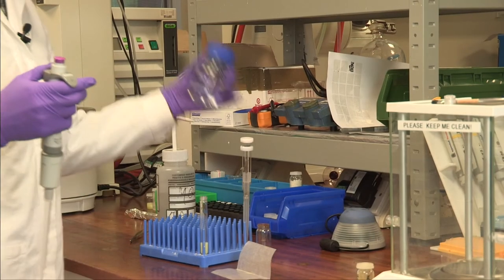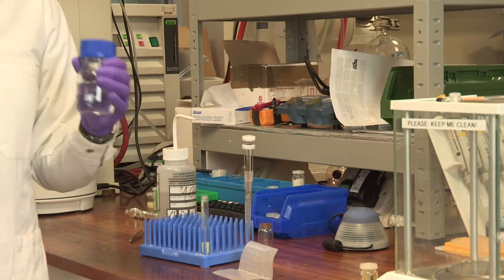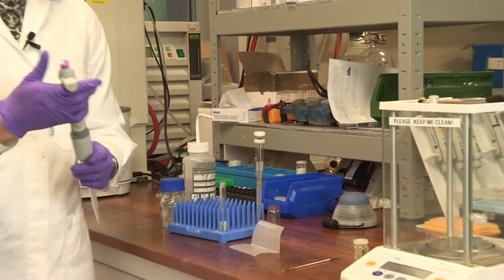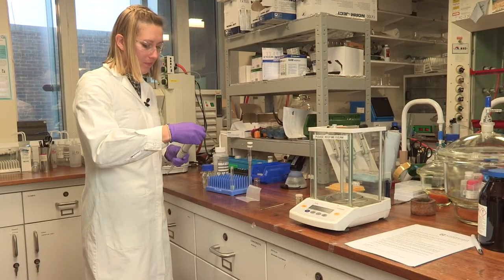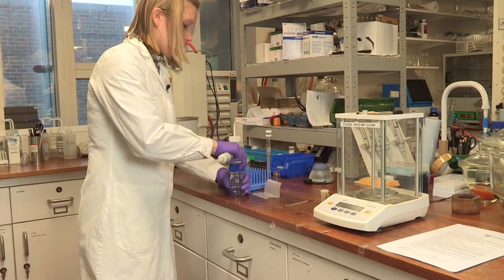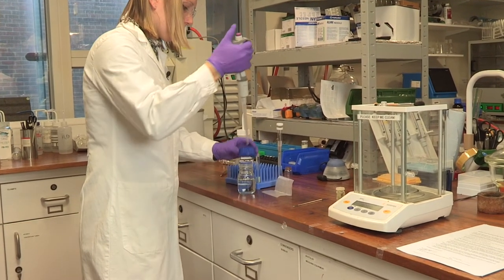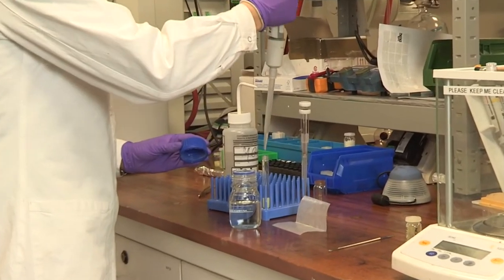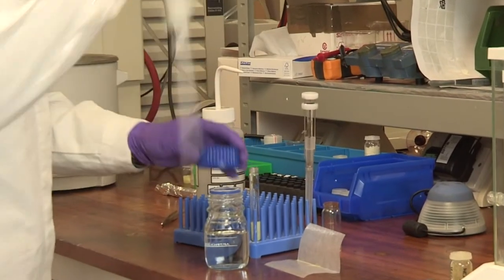The final component I'm adding is actually a basic solution — sodium hydroxide. The only reason we need that is to help break down the plastic in the first place. If we just stick plastic in water, it's going to take about 500 years to break down. This kind of helps jumpstart the process and helps the catalyst break it down and release the hydrogen.